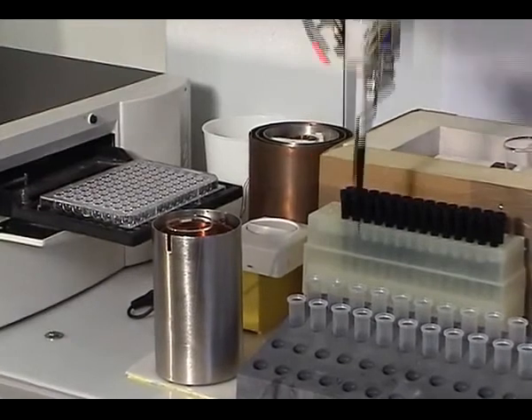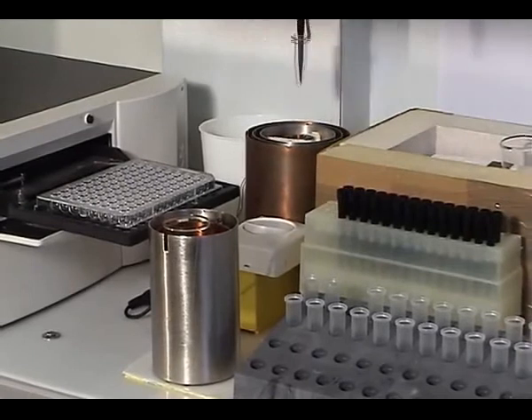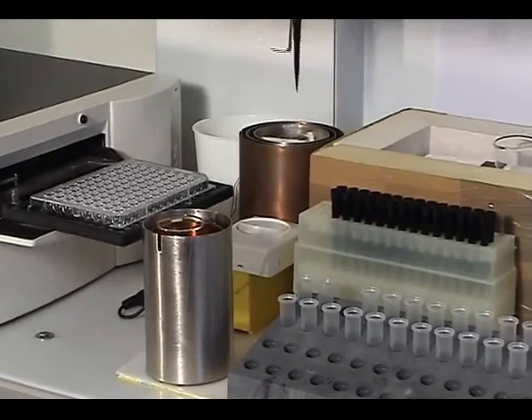Now, the second tube has been put back into the rack. And the same thing will be done for the third one, back into the coil, water into it.